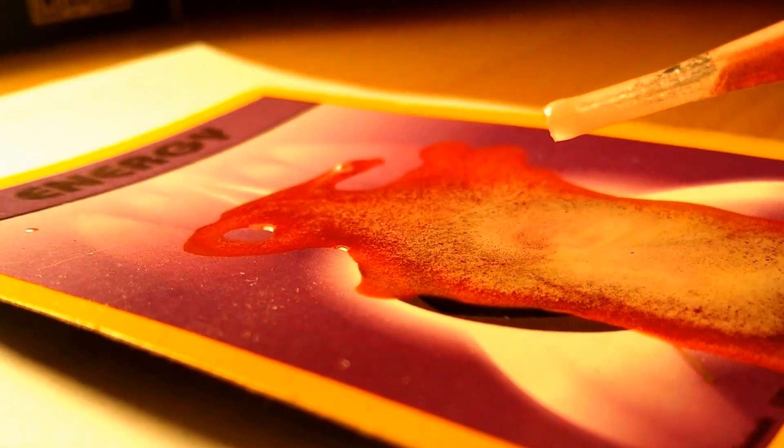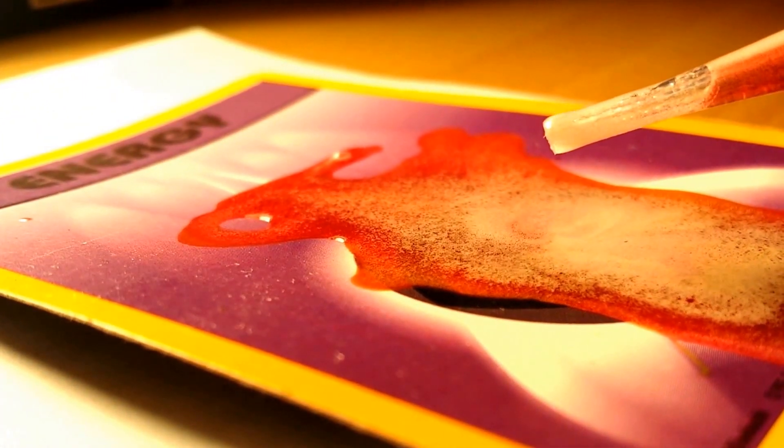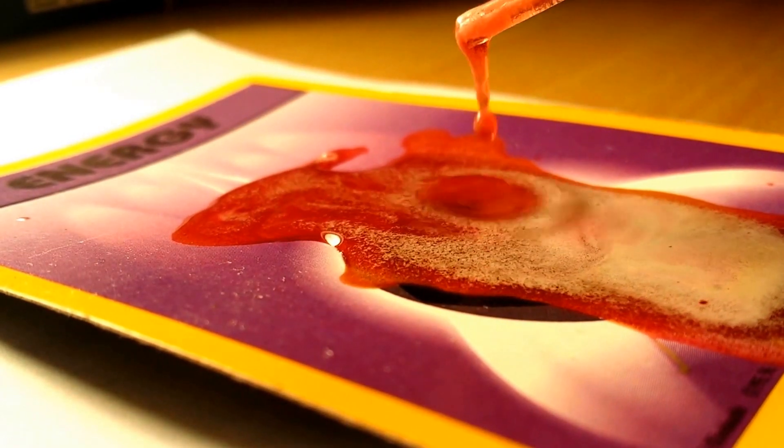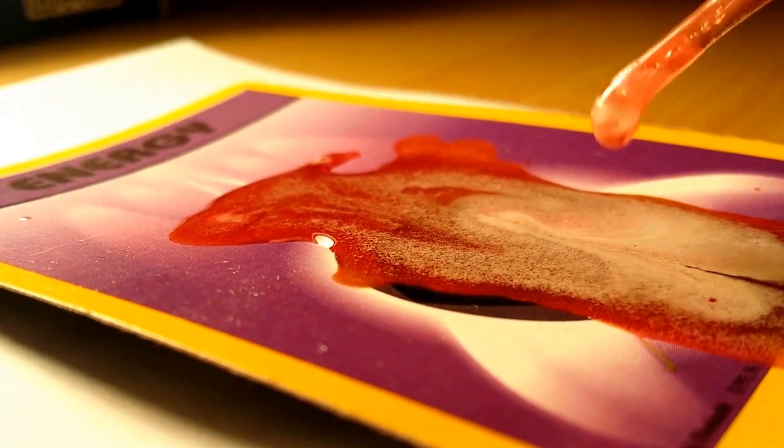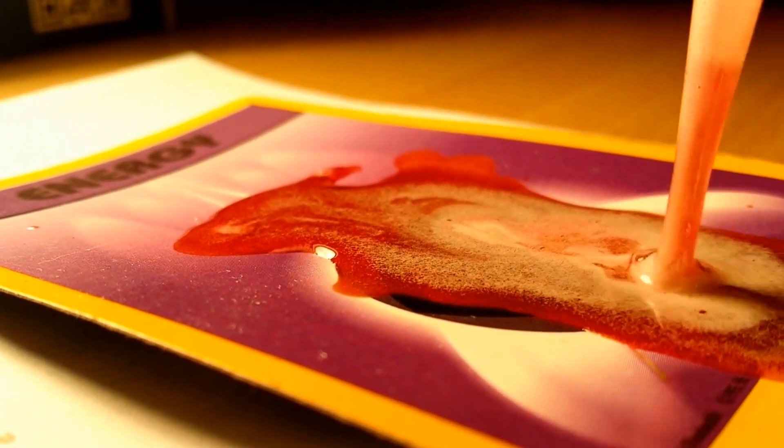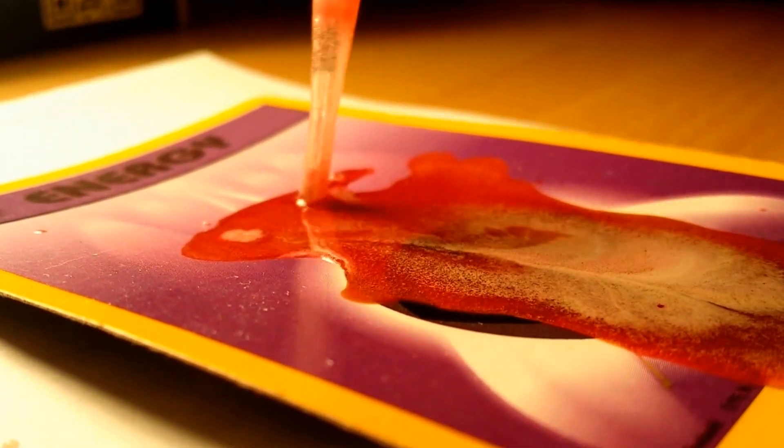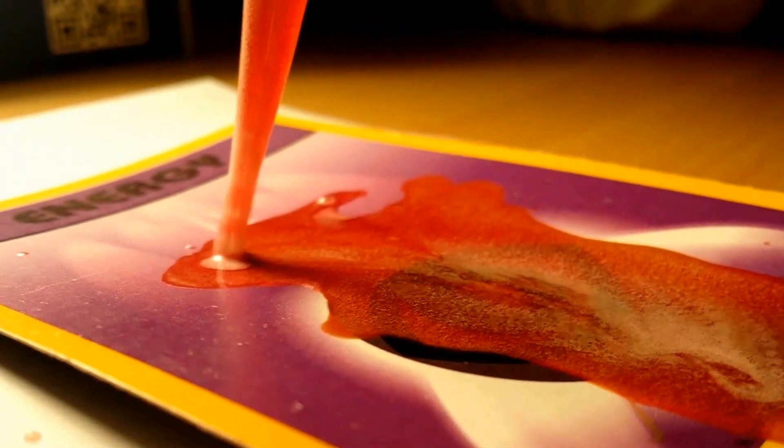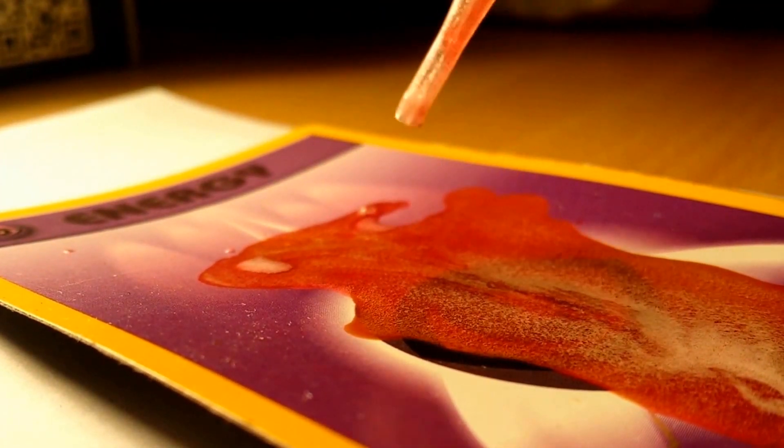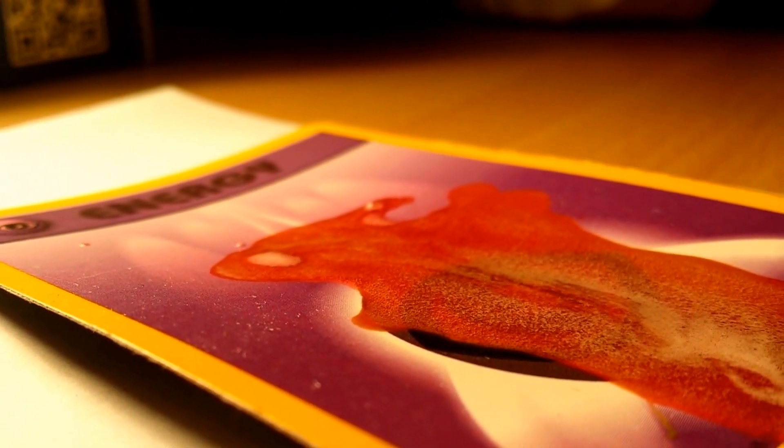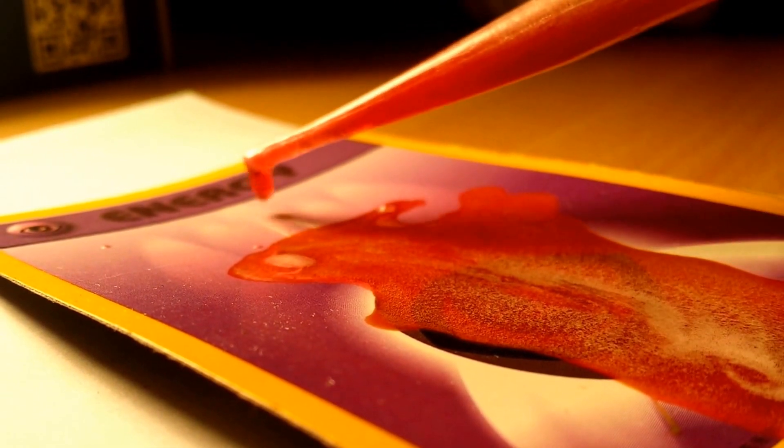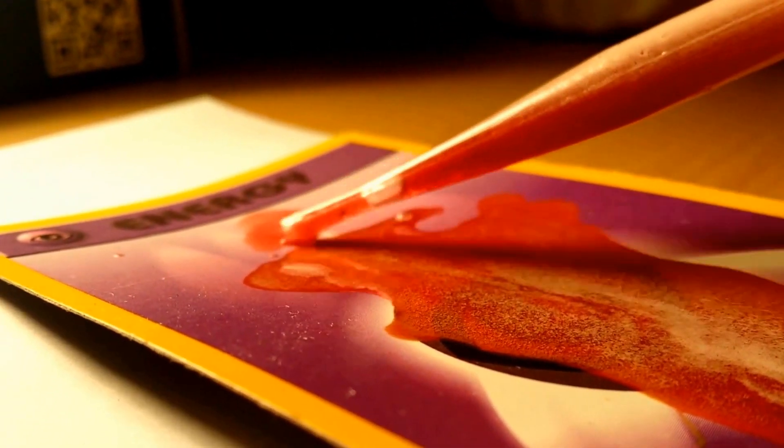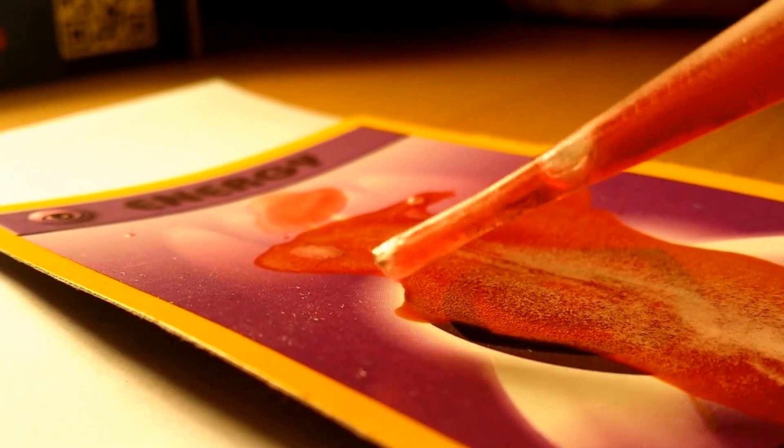Let me get a good camera angle here. Okay, we're just gonna squirt this out. Sucking up some sulfuric acid. Now, let's squirt a little bit out, just a little bit, not all of it just yet. Oh yeah, spread it around like it's a piece of butter.